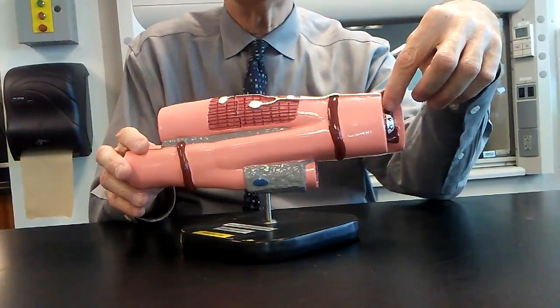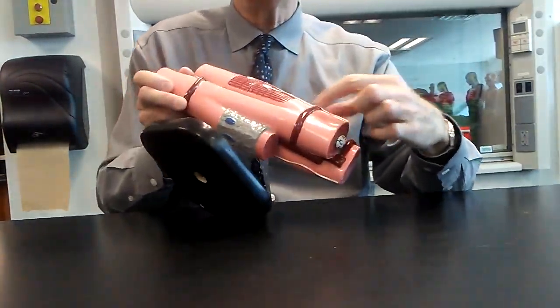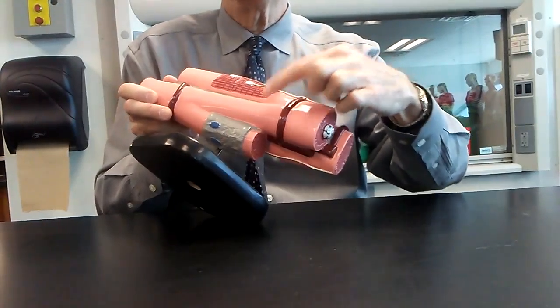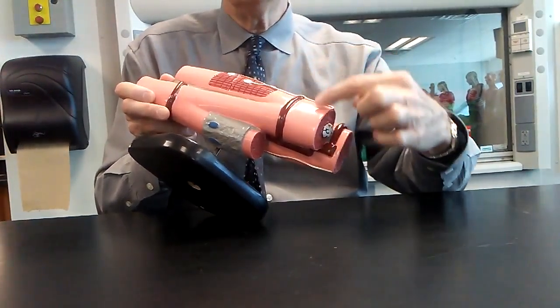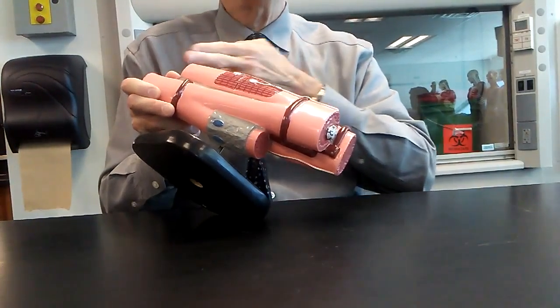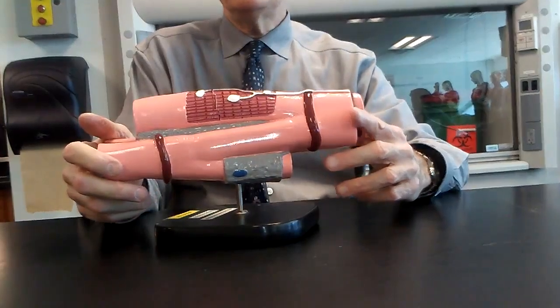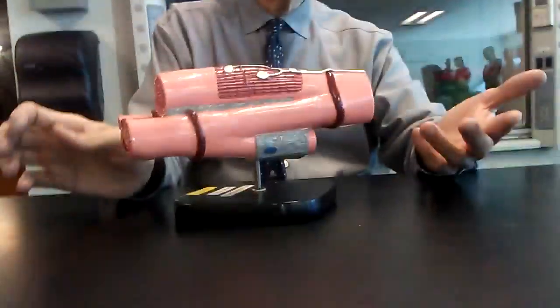Let's see, what else can we point to on here of value? Oh, here it's showing the bifurcation. The cell splits like a Y shape. So the bifurcation ends there at an intercalated disc. And then you've got a brand new cell on the other side of the intercalated disc. And I believe that's really it for cardiac.